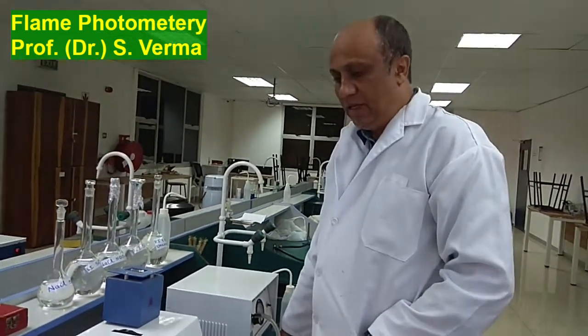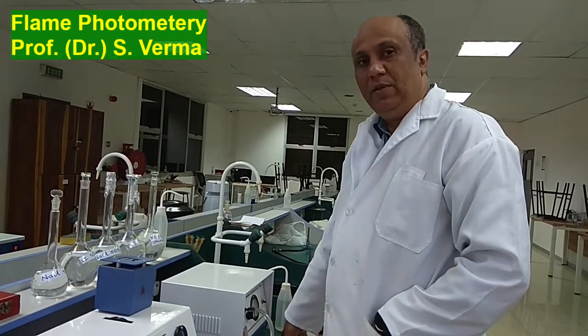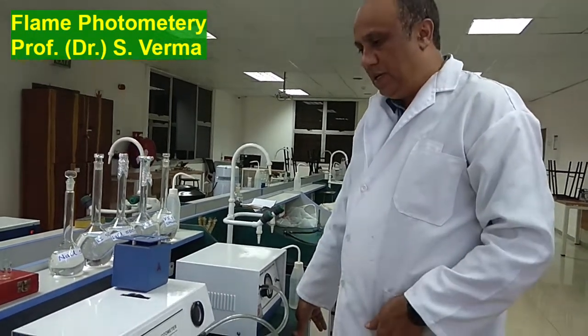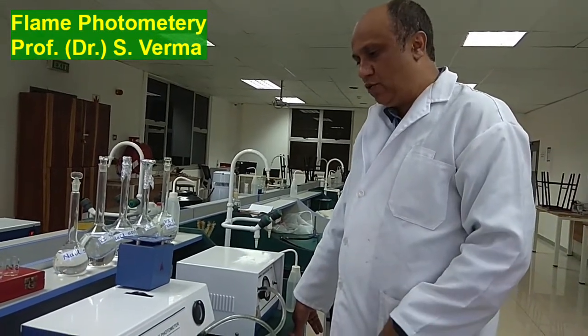Okay, students, so today we'll be doing another experiment that is on flame photometry. It's another analytical technique which we can use to find basically alkali and alkaline earth metals, as we discussed in the lecture as well. This particular technique basically is an emission spectroscopy. You have done all those absorption spectroscopy. In this one, we'll be recording emission. That's why it's not only called flame photometry, also called flame emission spectroscopy.